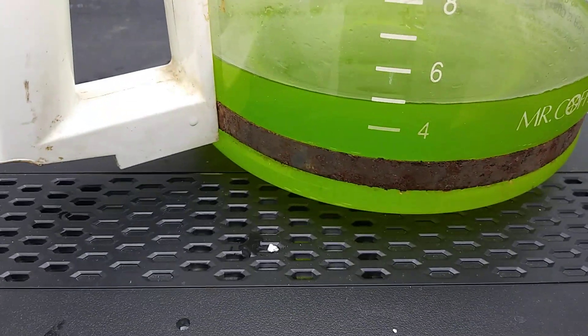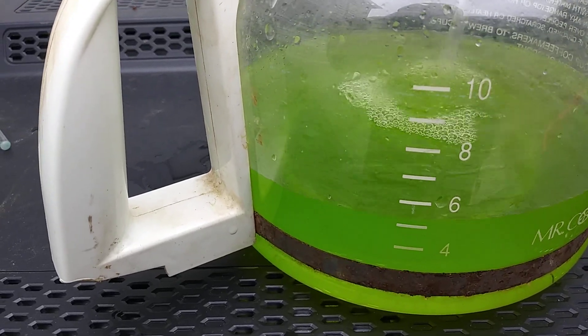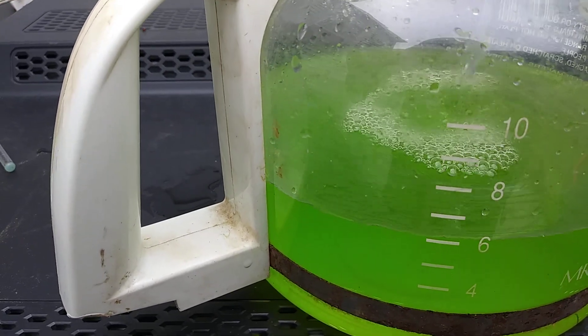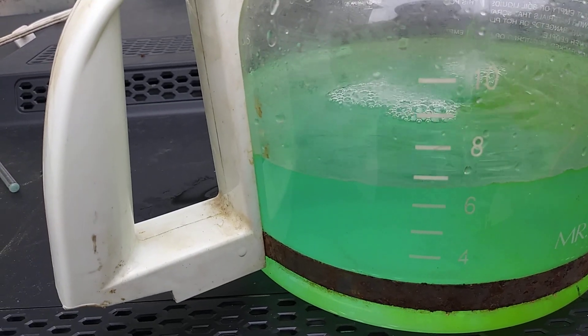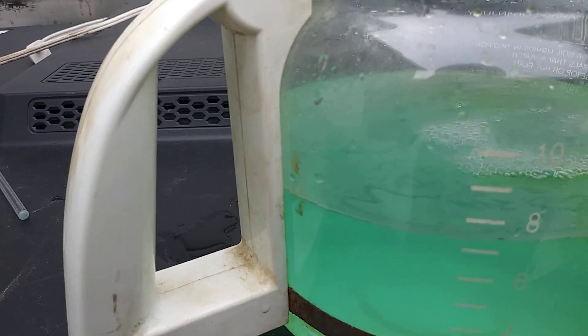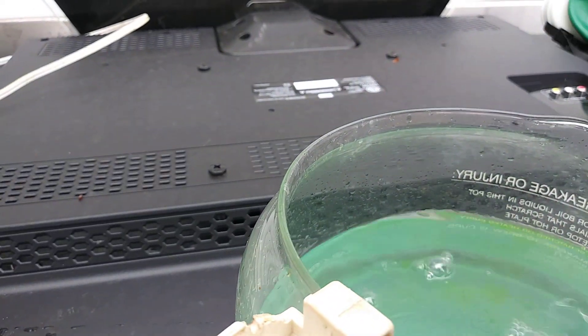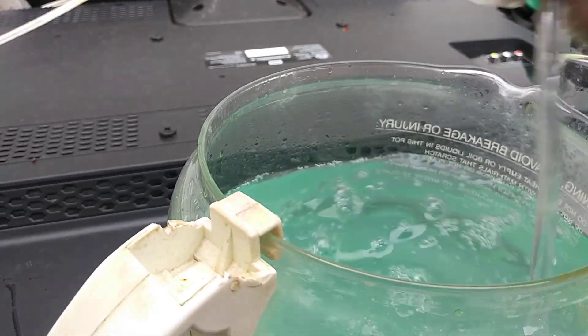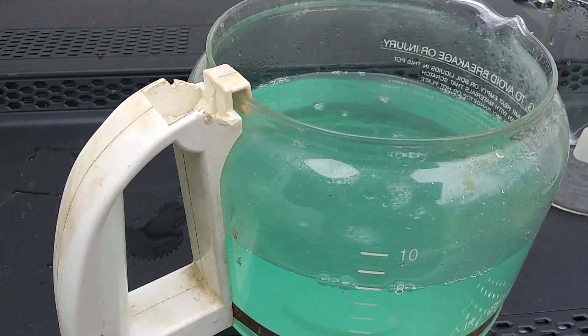All right, so here we go. If you watch the color, it'll turn. Hopefully really quick, that means a good amount of gold. So it's turning. Hoping it turns black. Just a little stir. We'll see what happens. Might take a while for this one, it looks like. Yeah, I don't know if this is gonna even turn.